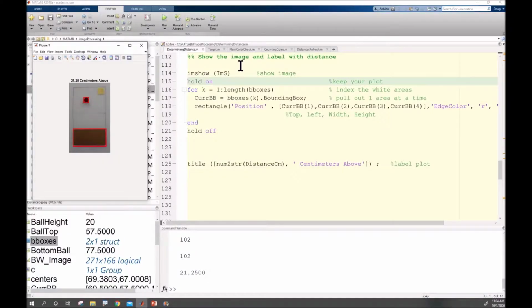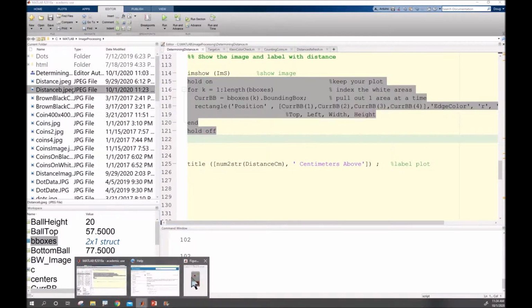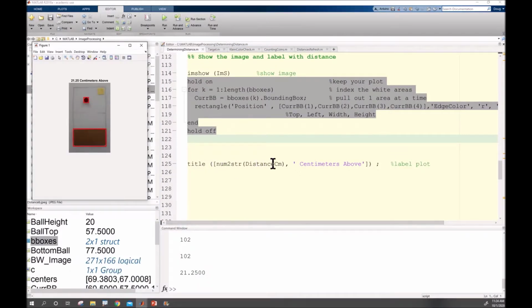The last thing I'm going to do is show my image. I'm going to bring in my bounding boxes, and title it with the variable that we found, and also centimeters above, and it should give me an image that looks like this. You'll notice that I did show the first original image, which has true colors, and we're doing all our math with our green, but it makes it look a little bit nicer.